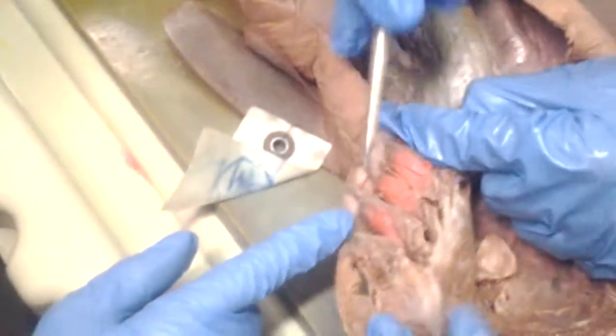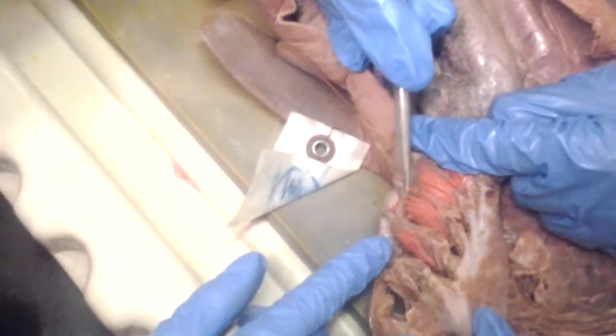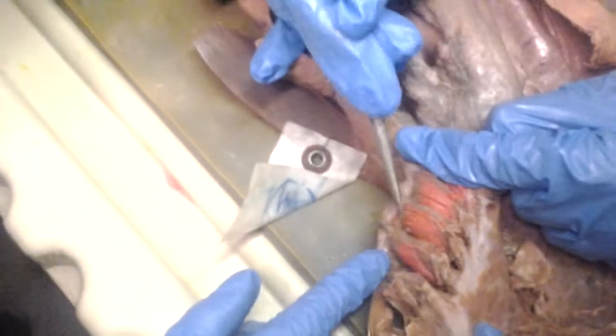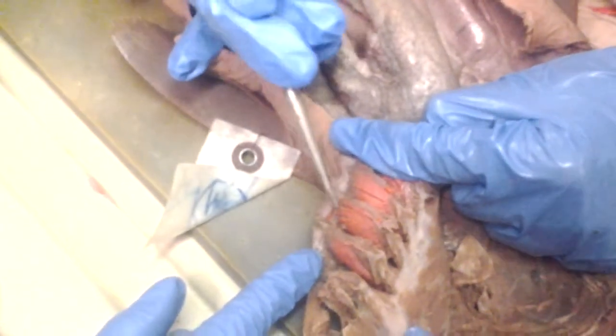Gill lamellae, yeah. So what are the gill rakers? These are the gill rakers. They're cartilage, made out of the gill cartilage, similar to the pointy fingers that we see. The lamellae is this brown stuff that's the actual gill itself. These red are blood vessels going to it. The gill itself might be a little bit red too because the blood really goes into it.